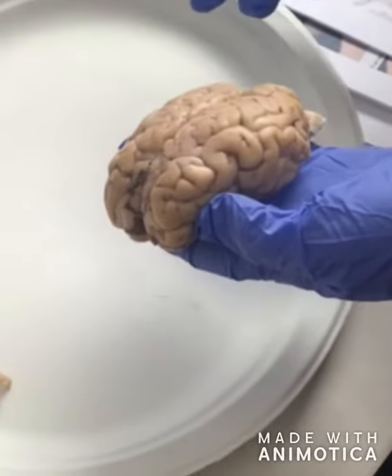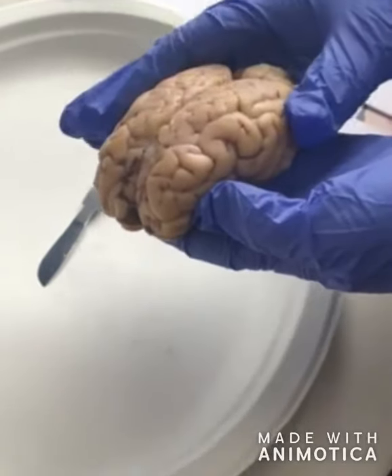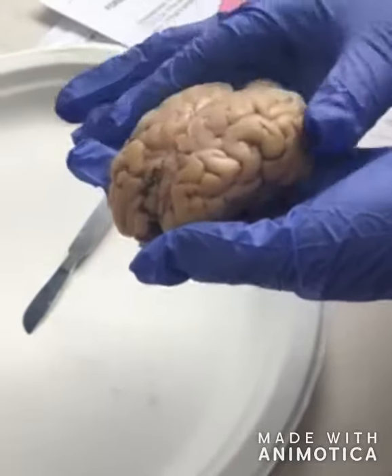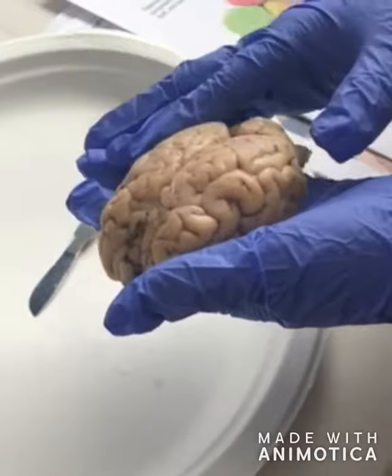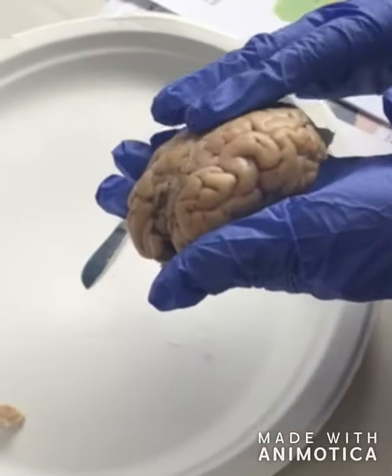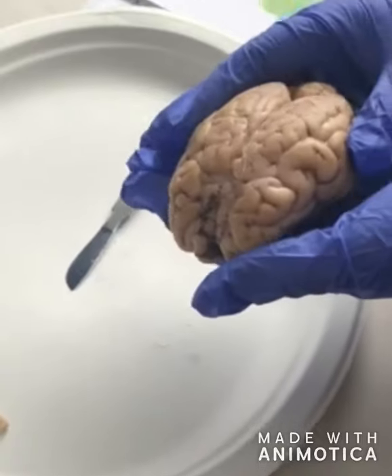Meninges: the function of the meninges is to protect the central nervous system. We have, not on this specimen, but there is a dura mater. It's a membrane that covers the brain. It is the first of the 3 layers, and it is very tough. There's also an arachnoid membrane and a pia mater, which are the second and third layers, with a web-like appearance. The pia mater is a membrane closely attached to the brain surface. But like I said, it's not on this specimen, but those are parts of the meninges.